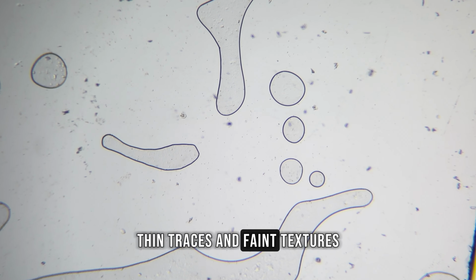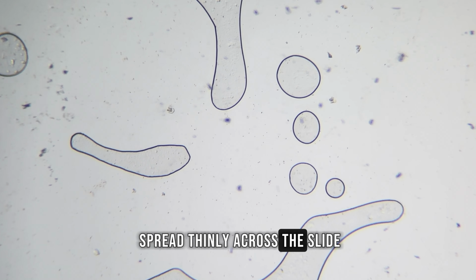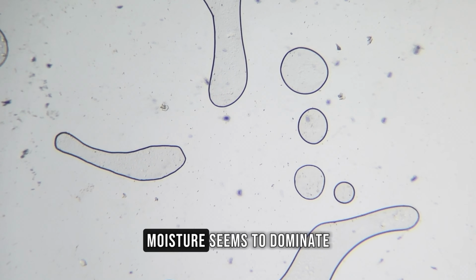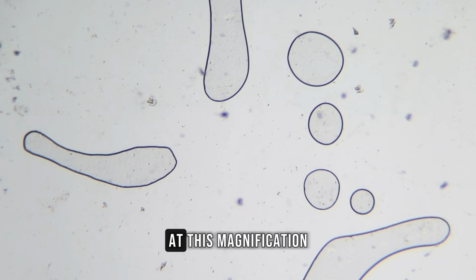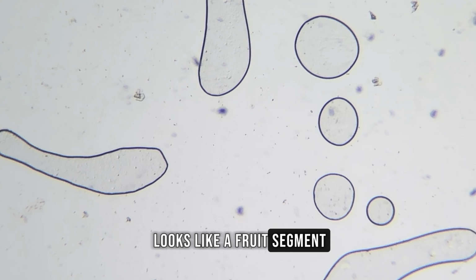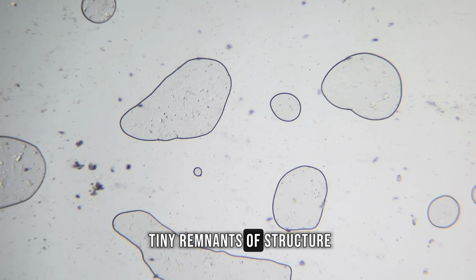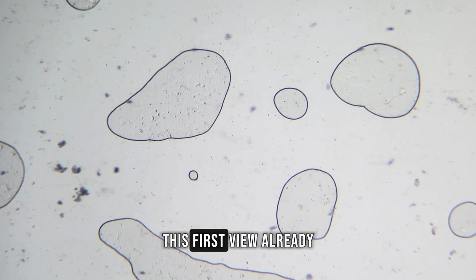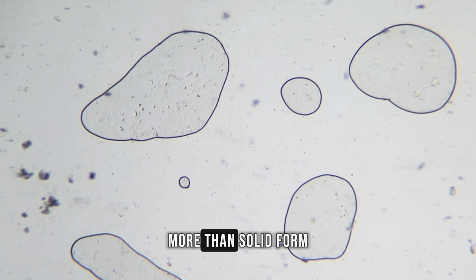Thin traces and faint textures hint at dissolved material spread thinly across the slide. Moisture seems to dominate everything at this level. At this magnification, the mandarin no longer looks like a fruit segment. It looks more like a watery layer holding tiny remnants of structure. This first view already suggests that mandarin is built around liquid more than solid form.